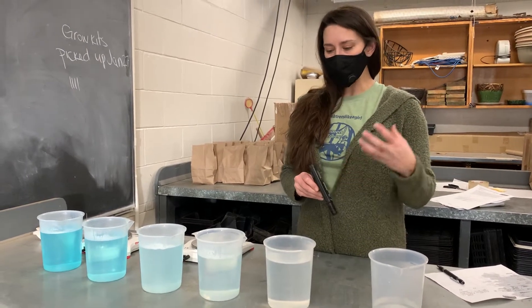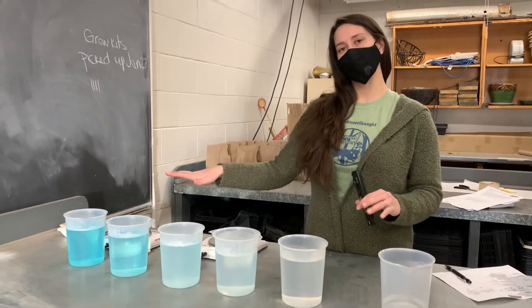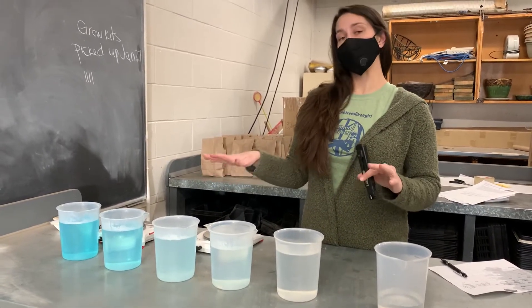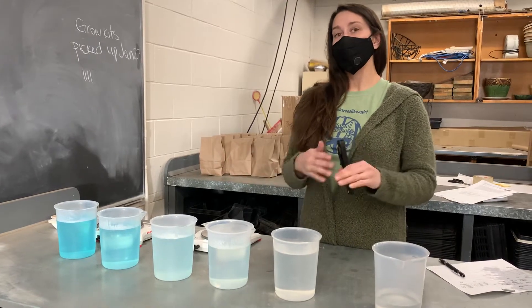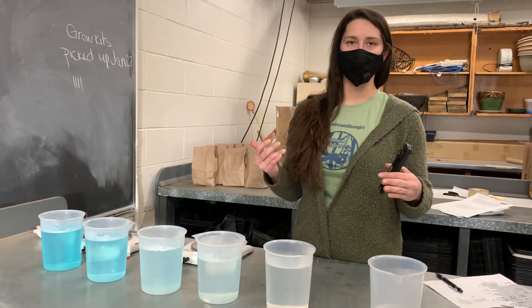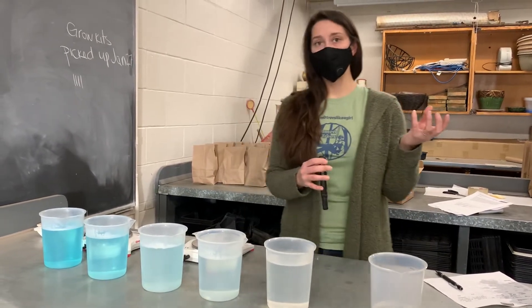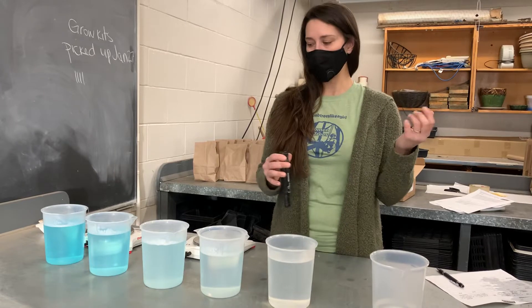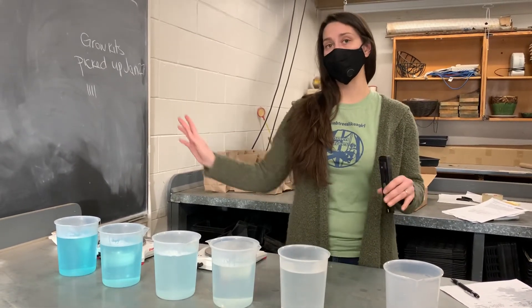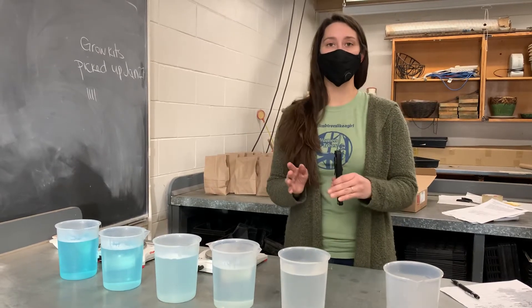This is one of the few experiments that we can actually just mix different rates of fertilizer and figure out where the toxic level would be for our seedlings, without actually doing some sort of lethal test and sacrificing our seedlings. We have to do that a lot in greenhouse and horticulture science, but this is one test where we can rely on other people who have done this and killed their own seedlings and come up with an established number.